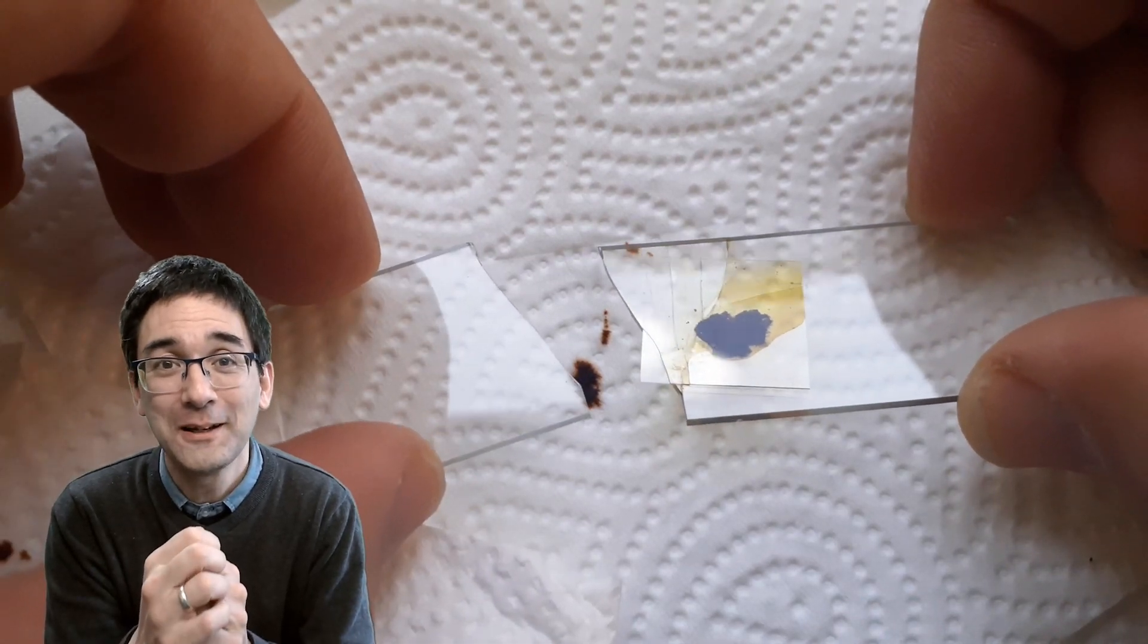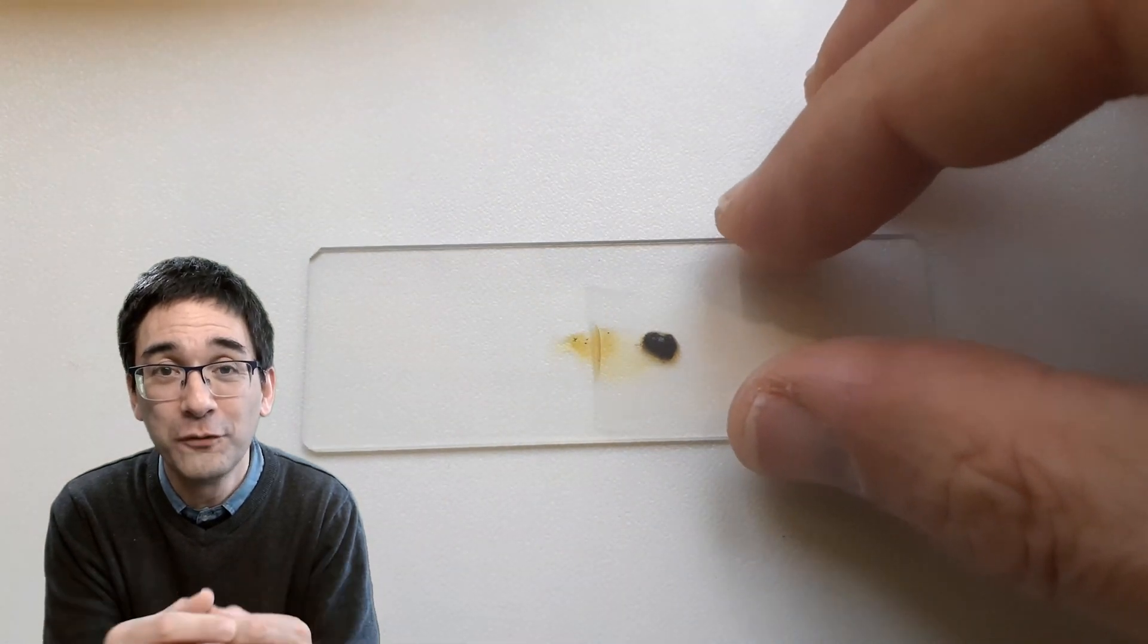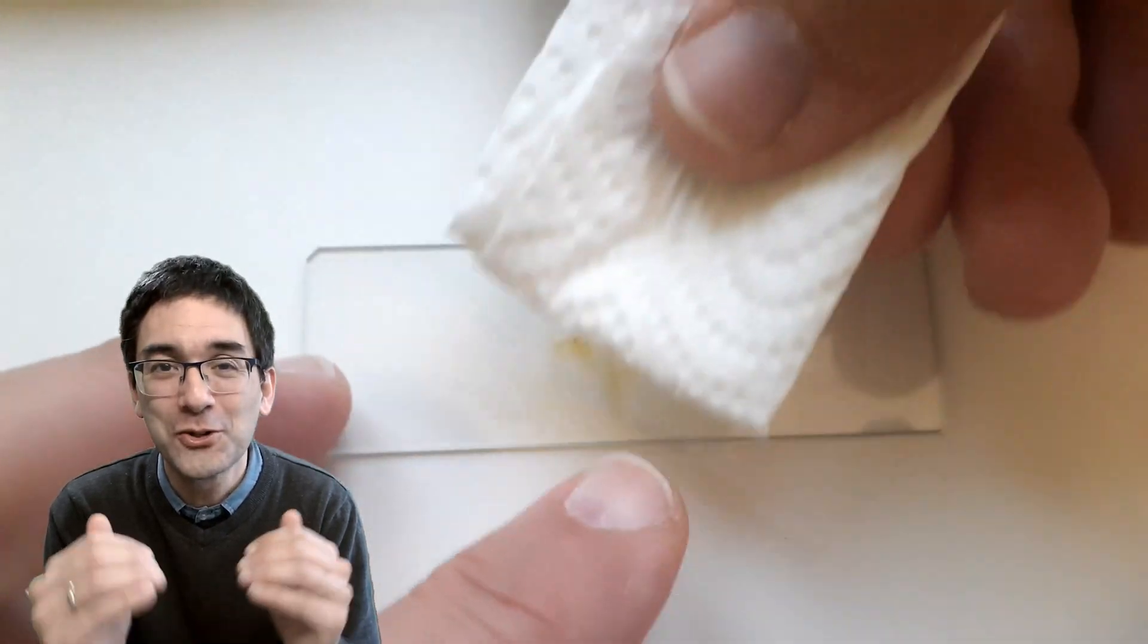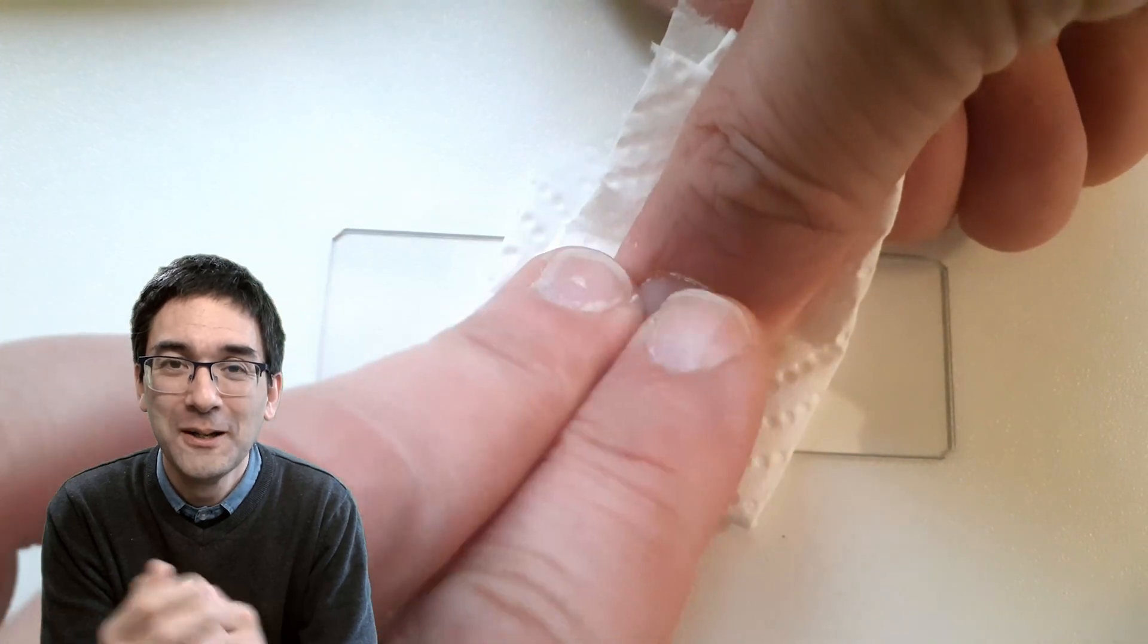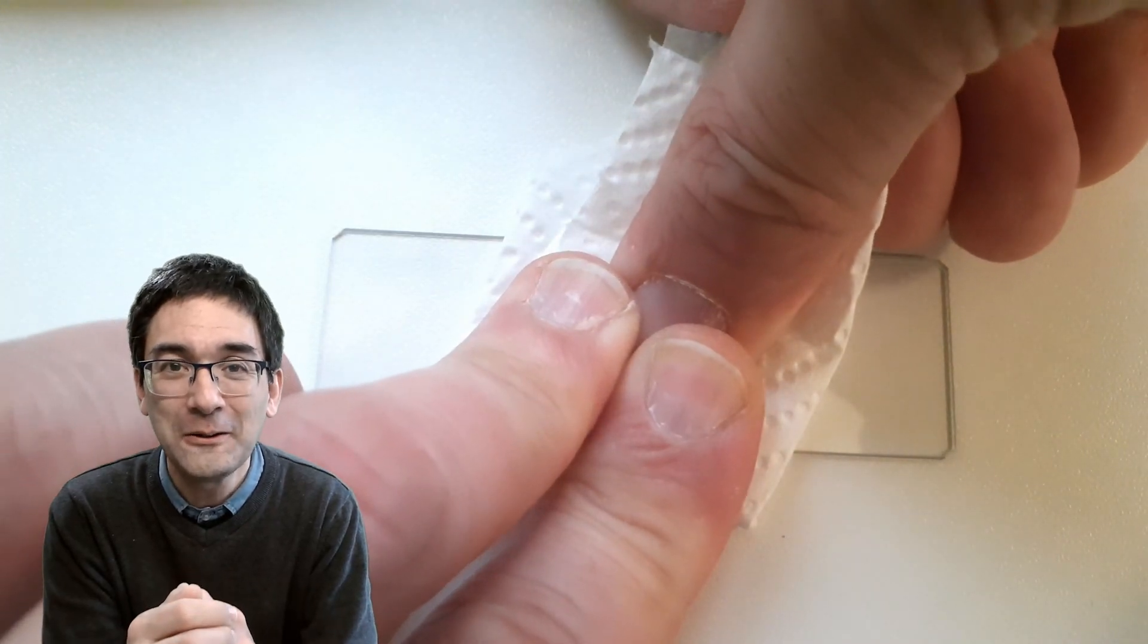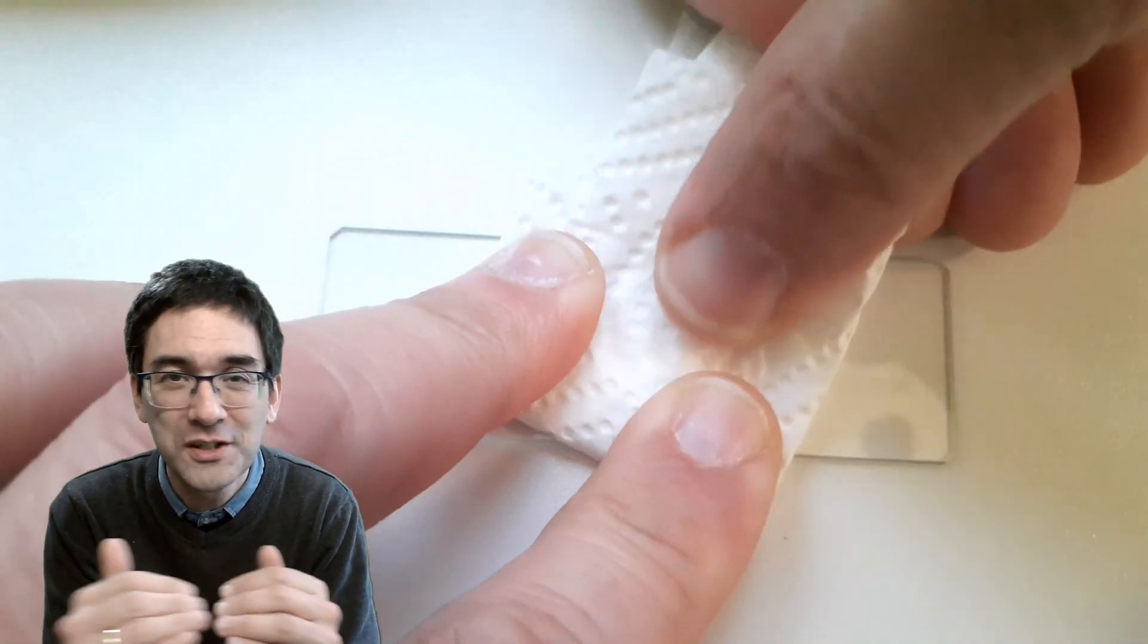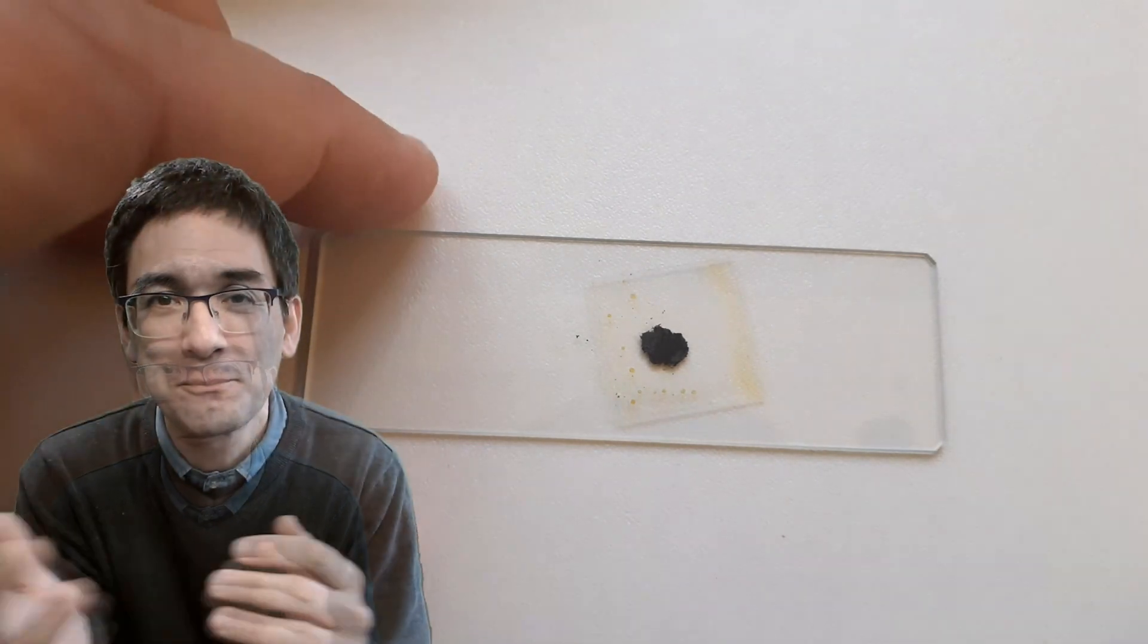I made a stupid little mistake. Maybe you've already seen it. I placed the slide on a soft surface, on some soft tissue paper. That's something you don't want to do. You need a hard surface, a hard table top, otherwise the slide's gonna break. So I'm trying this again here, pressing down vertically. You don't want to have any horizontal forces here, no shear forces, just the vertical pressure is fine.